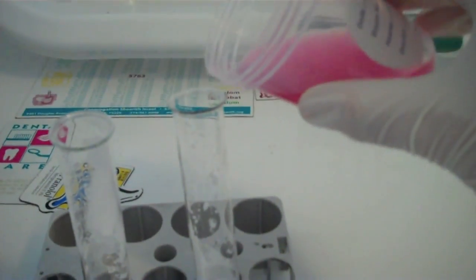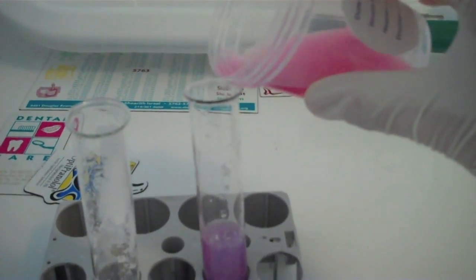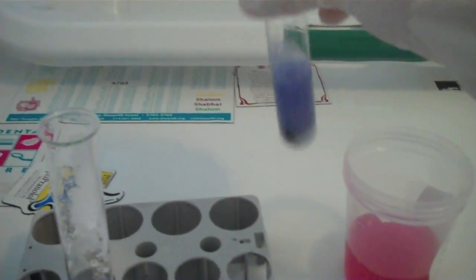Actually I have a little bit too much sodium hydrogen carbonate, so I'm going to try to equalize the amount to the sodium carbonate I've made. That's better. Now I'm going to add a red cabbage pH indicator which I made in a previous video. I'm adding it to the baking soda now, the sodium hydrogen carbonate, and you can see it turns blue.